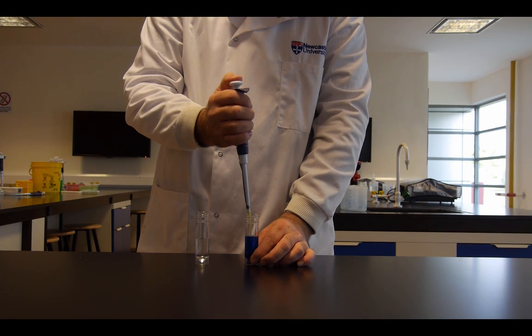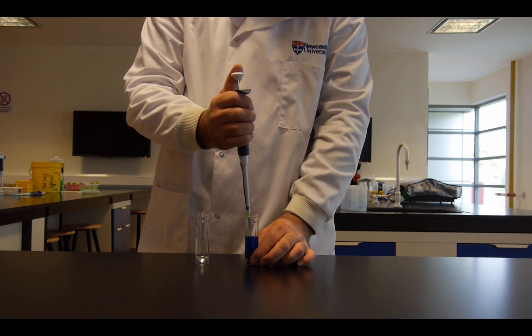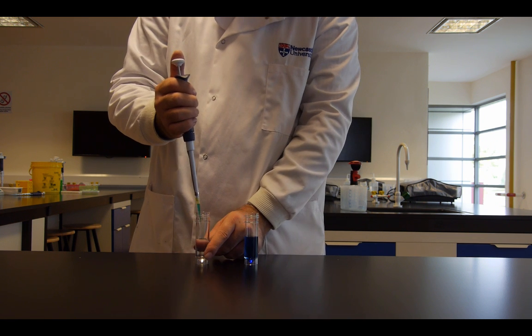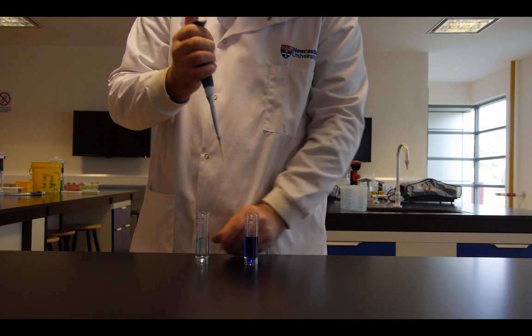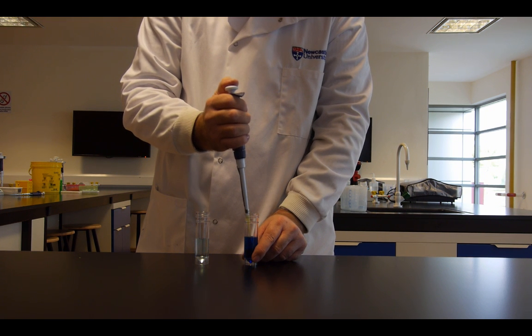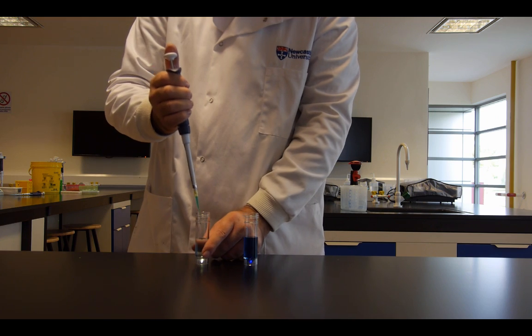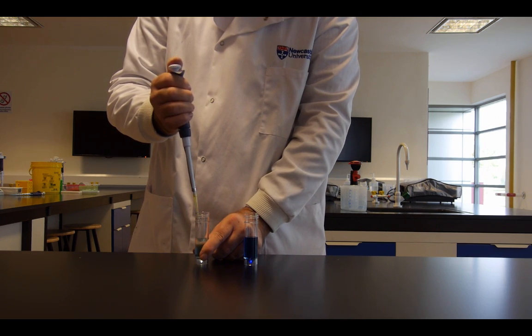The same action is carried out with a P200. Down to the first stop, into the liquid, bring your thumb up slowly, over to the other container, push to the first stop, pause and then push further down.